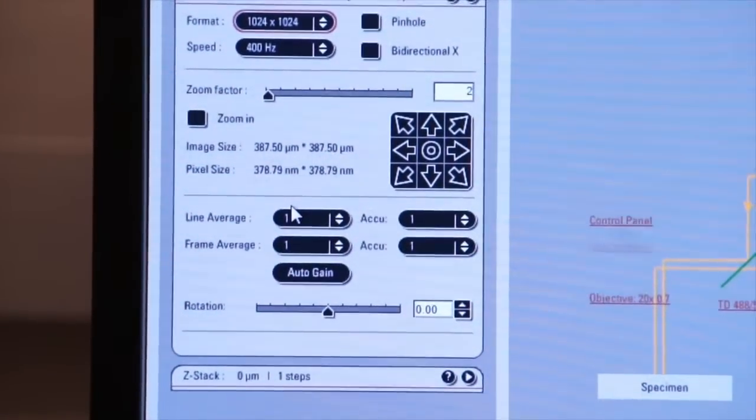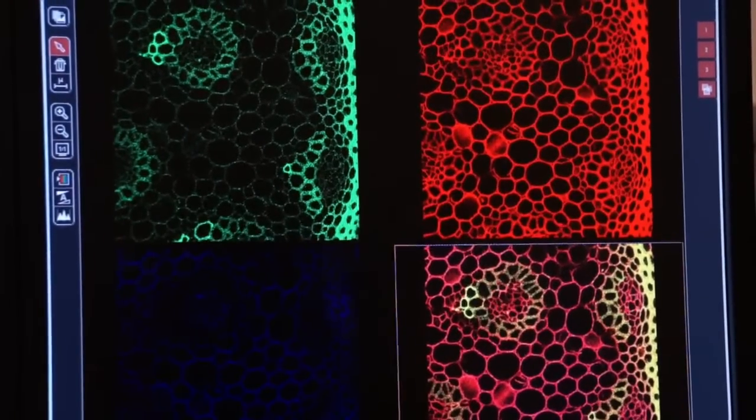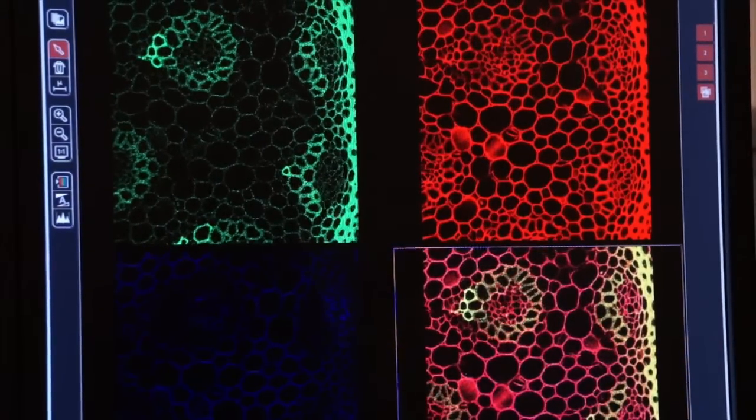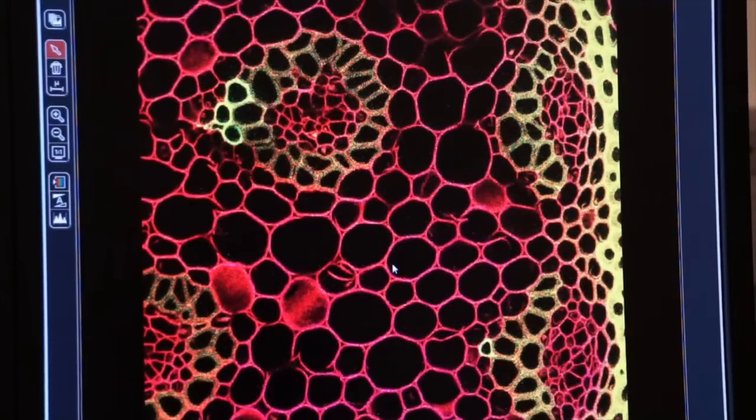We'll click on Capture Image again. You'll see the system capture an image. It took a little longer that time. Why? Our resolution has doubled. And now you can see it's a little bit better image, but it's also becoming a little grainier. How do we eliminate some of that grain?